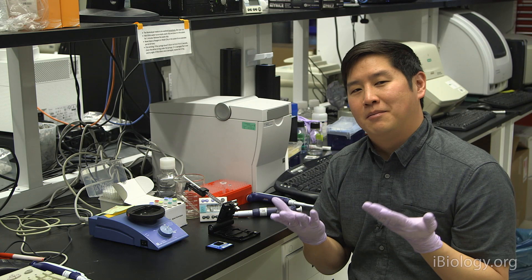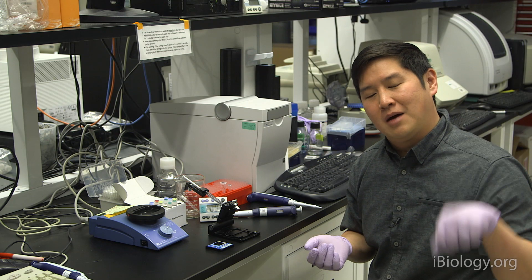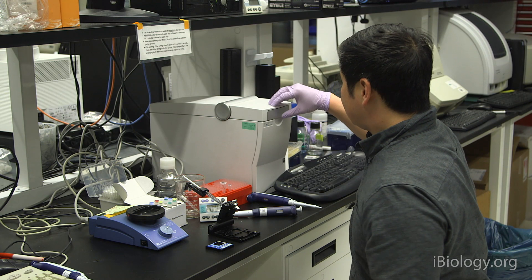All this does is wash off any salts and debris that might be on the surface of those electrodes. Once the wash is done, go ahead and remove the chip, and you can just dump out the water into the trash and save the chip for future runs.